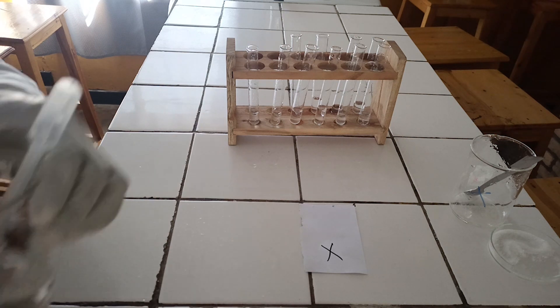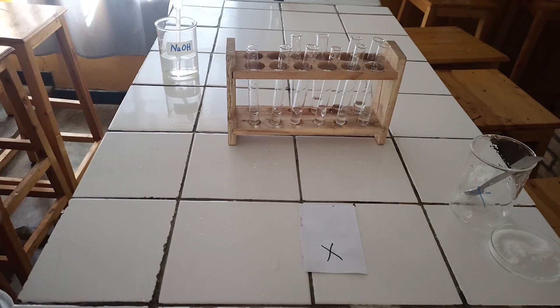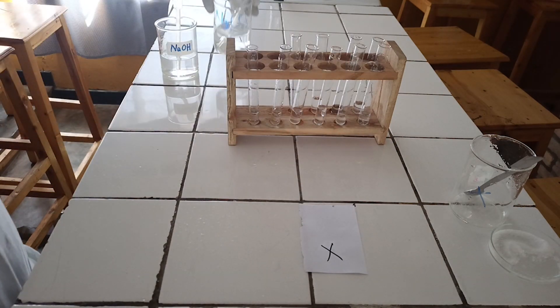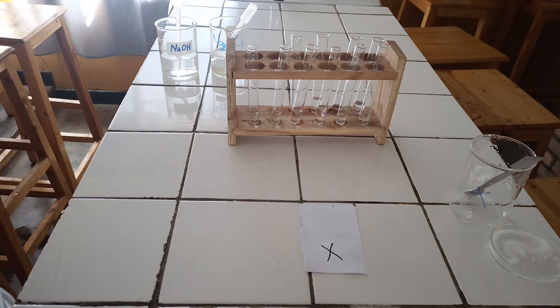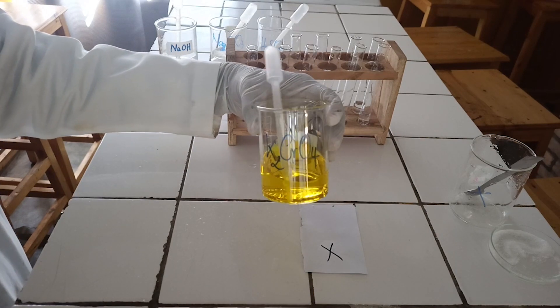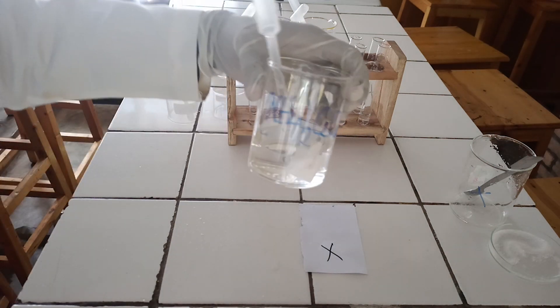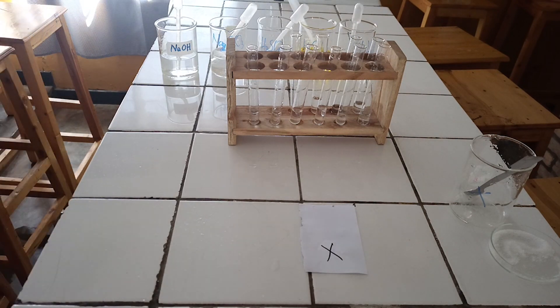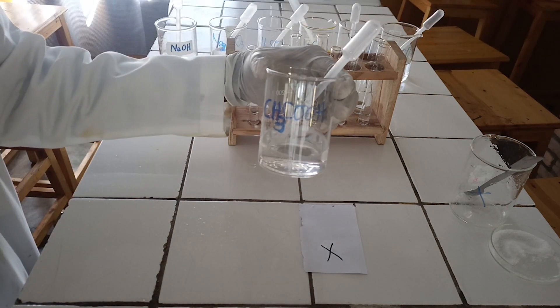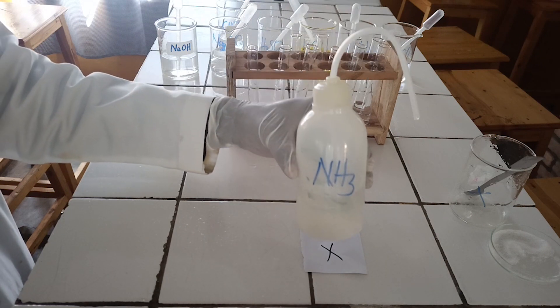Chemicals required: 1. Sodium hydroxide solution. 2. Sodium carbonate solution. 3. Diluted sulfuric acid. 4. Potassium chromate solution. 5. Ammonium oxalate solution. 6. Diluted hydrochloric acid. 7. Acetic acid solution. 8. Diluted ammonia.